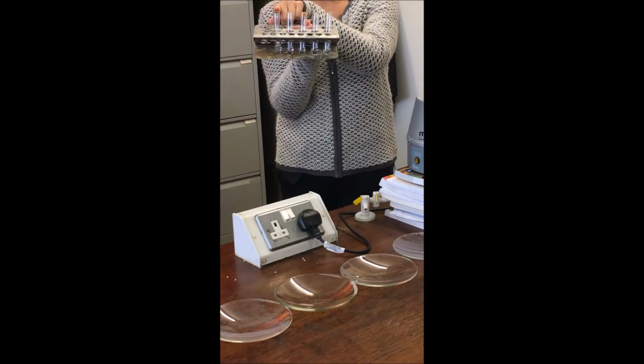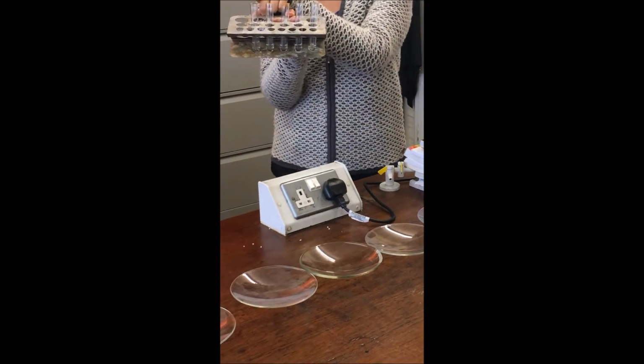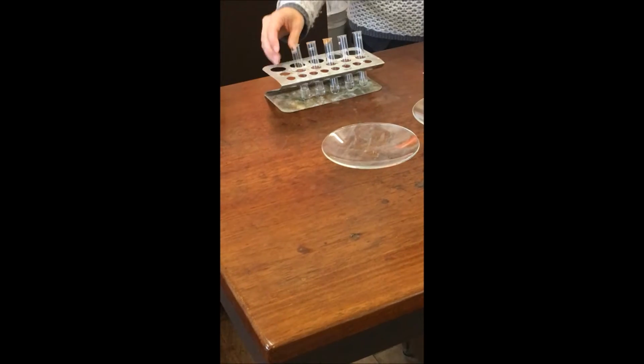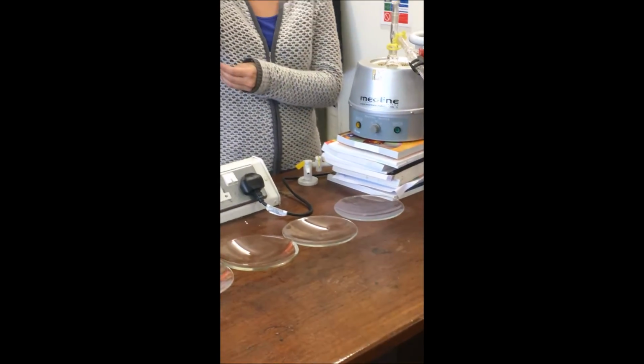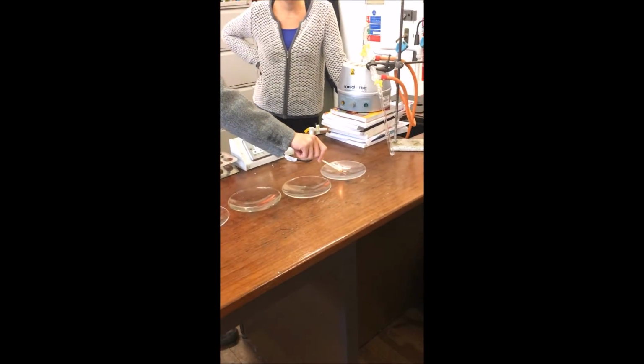So we're trying to find different trends in the crude oil fraction and to test their boiling points and flammability. Okay. Here comes a fun bit.